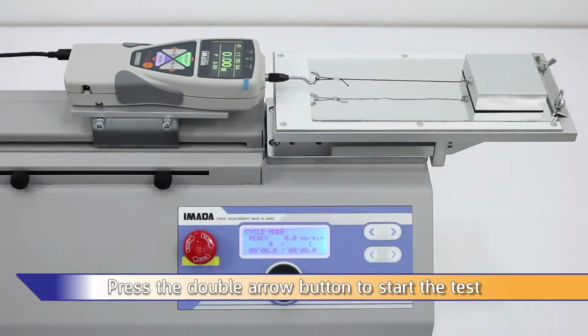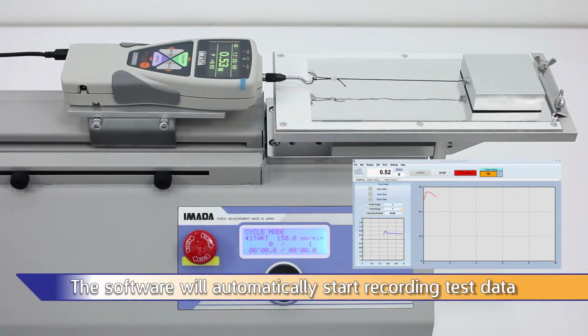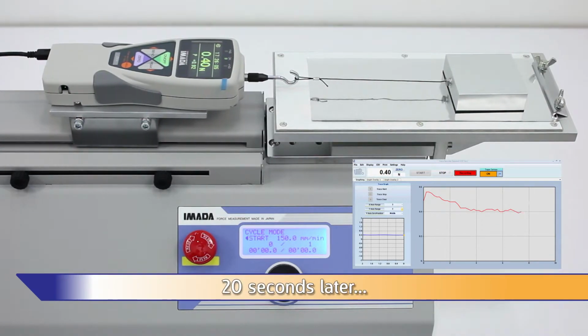Press the double arrow button to start the test. A screen capture of the software is shown above. The software will automatically start recording test data. The test will run until the travel limit is reached.